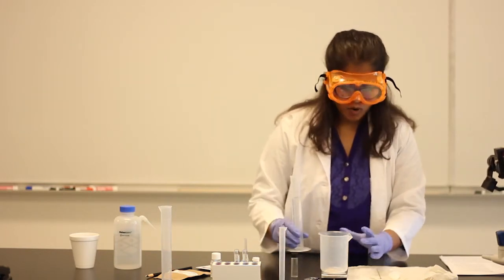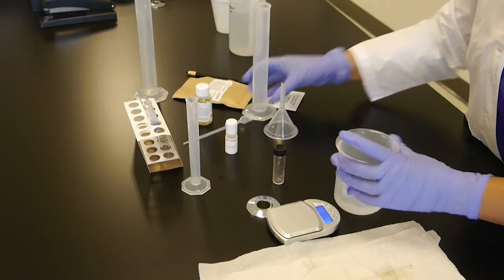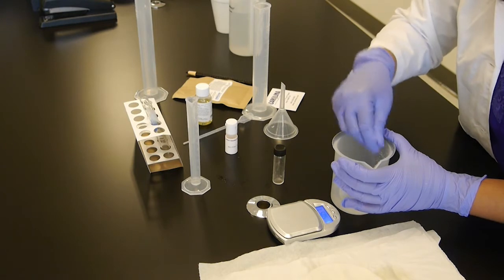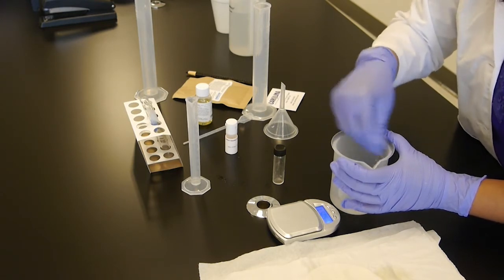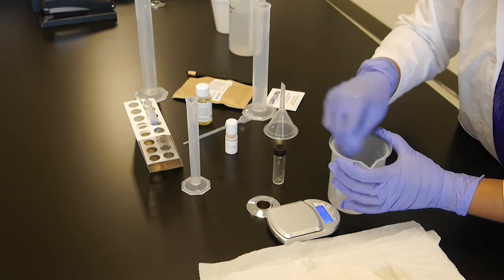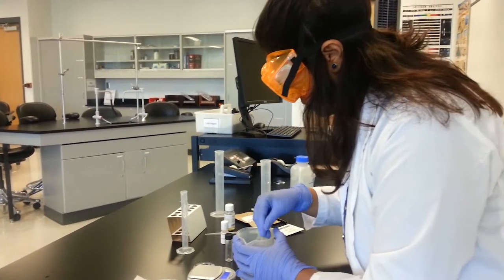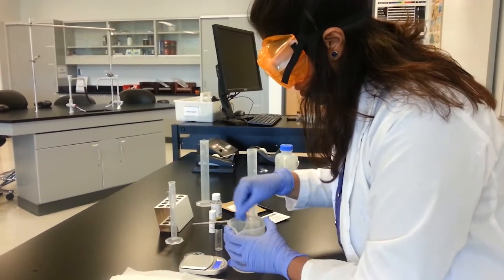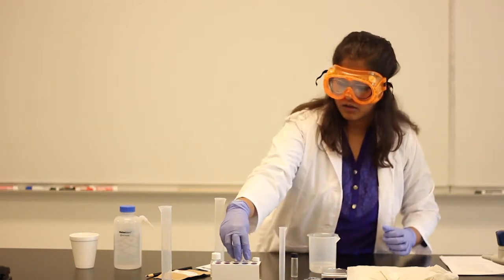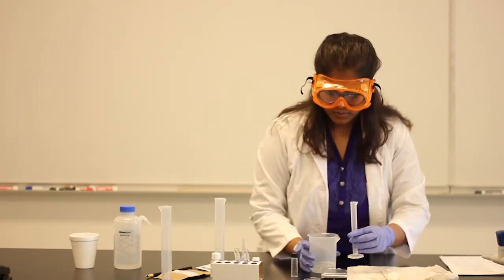Here I have purified water, 50 ml. Let me prepare a soap mix. Let's mix well. Make sure to mix all of the soap that you got filtered out from the vial. So now what I'm going to do is take 2 test tubes, 1 and 2, already marked. In each of them, take about 5 ml of this soap mix.